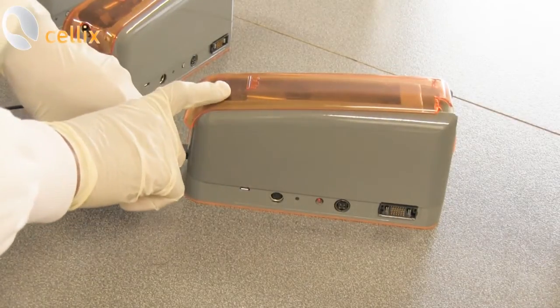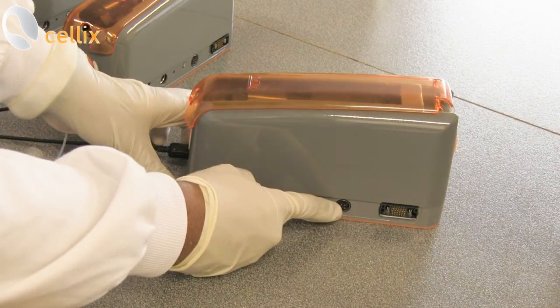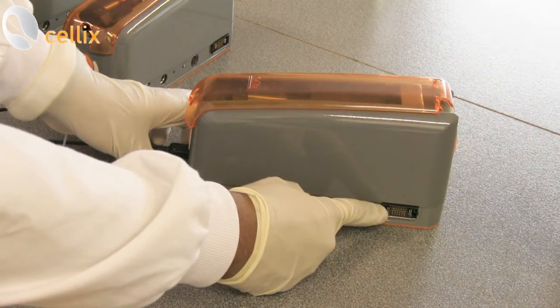This is a master pump. You can see the power switch, the socket for the power supply, and the connector for the other pump.